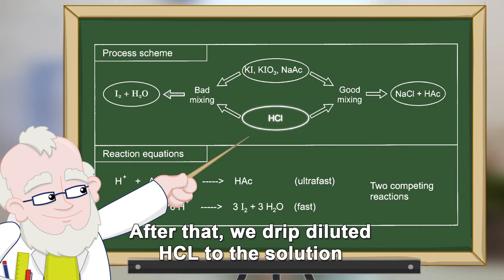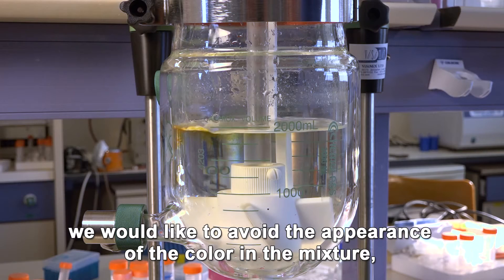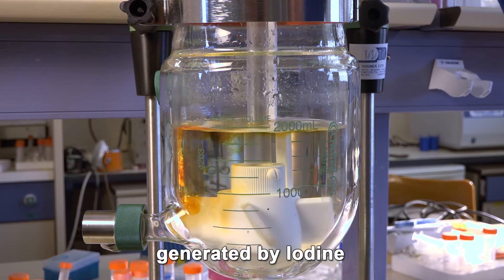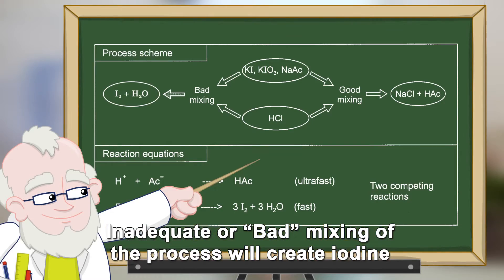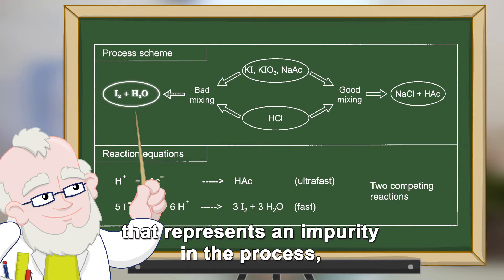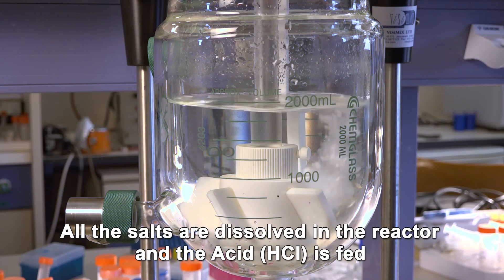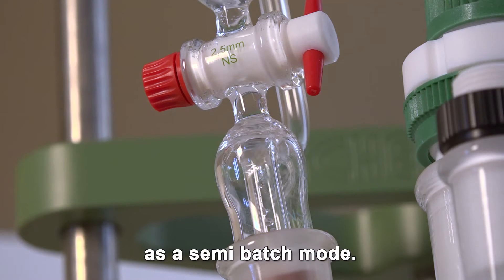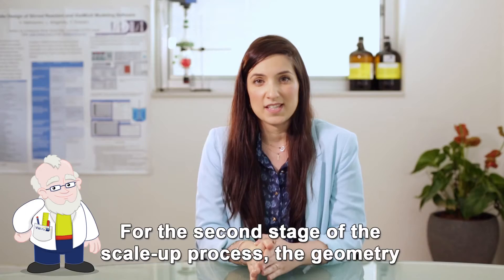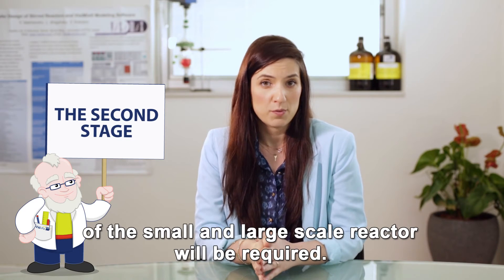After that, we drip diluted HCl to the solution in order to generate NaCl and acetic acid. We would like to avoid the appearance of color in the mixture generated by iodine. In inadequate or bad mixing of the process, we would create iodine that represents an impurity in the process, or some undesirable color in the product. All the salts are dissolved in the reactor, and the acid HCl is fed in semi-batch mode. For the second stage of the scale-up process, the geometry of the small and large scale reactor will be required.